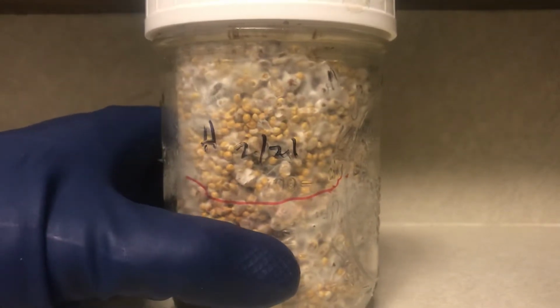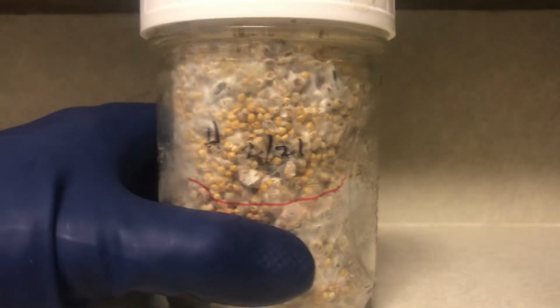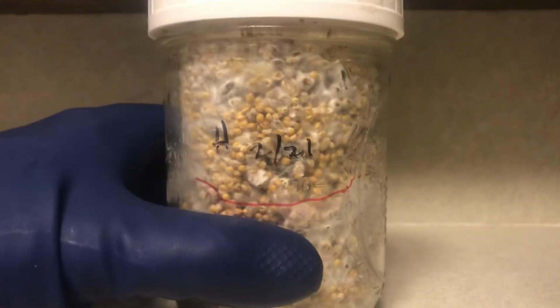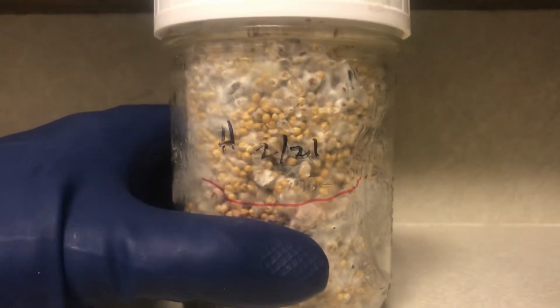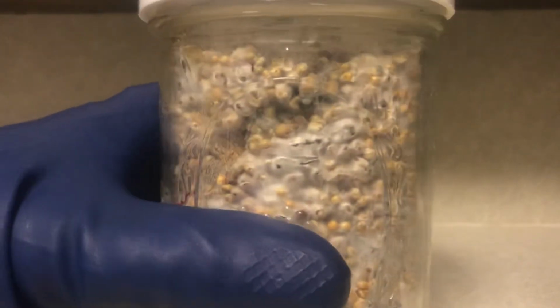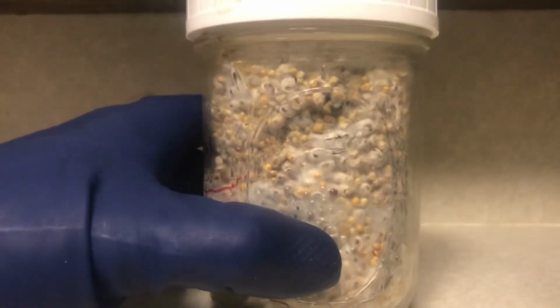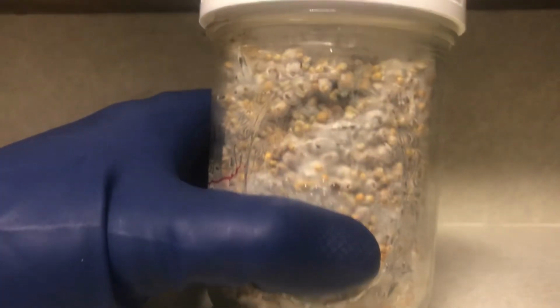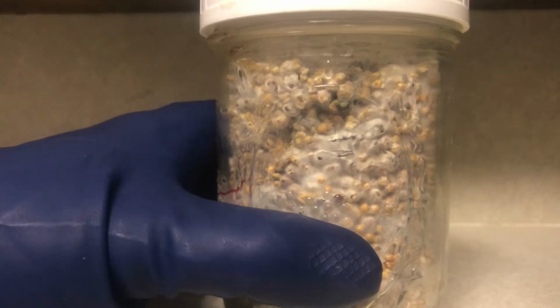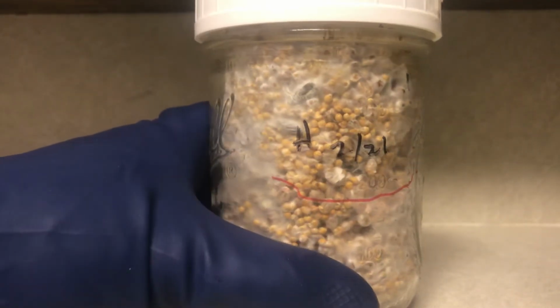So, you know, I've been doing this for a couple years and I still get jars like this. You do everything right and something happens and it just doesn't work perfectly. So even if it only had this spot and didn't have the larger spot at the base, I would still suggest you take the jar, open it up outside, and throw it outside. You might get lucky and get some mushrooms off of it, even after it's been outside.